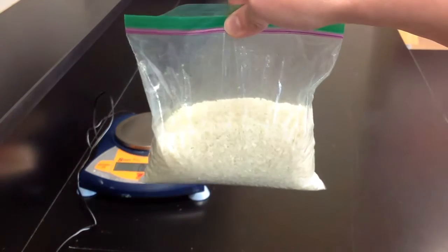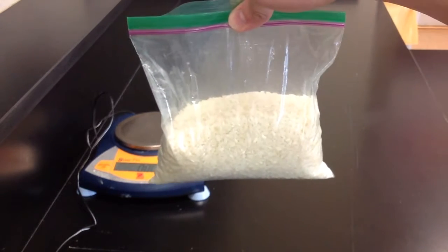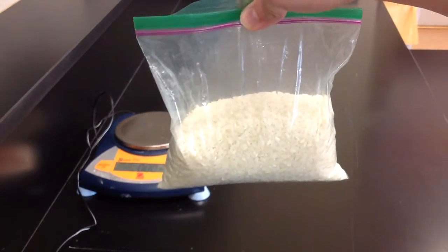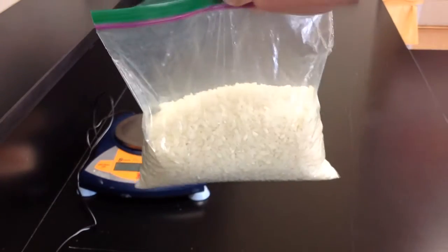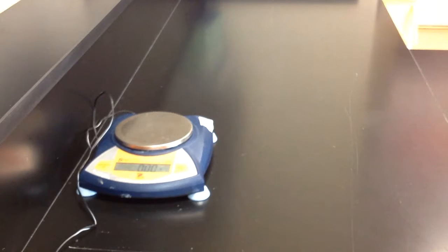Now, for number 2, how can we most quickly estimate the number of grains in the bag? Well, if I know the mass of a small sample, say 10 grains, and if I know the mass of the entire sample, and if I can do a comparison between those two, then I'll be able to figure out how many large grains of rice I have. So that is the process we're going to step through, and this is a process that you will be doing shortly in class. So follow along for the procedure.